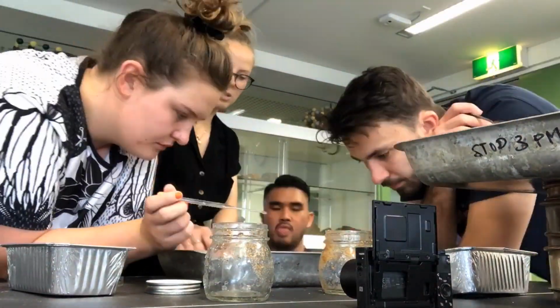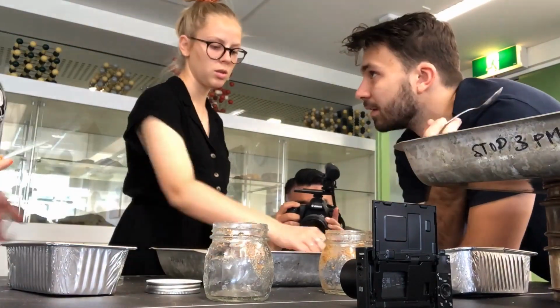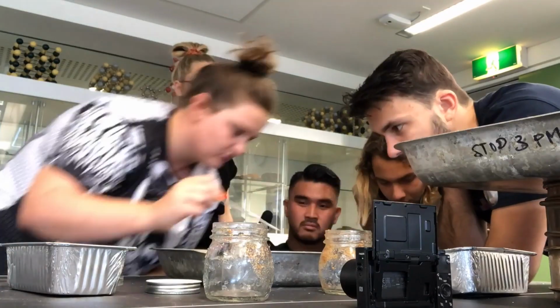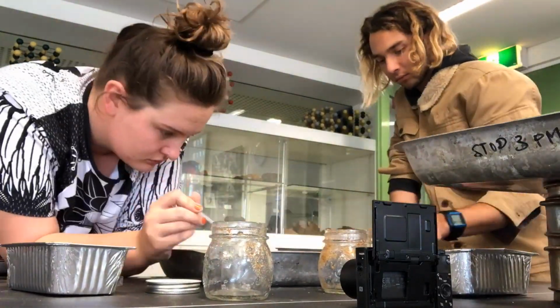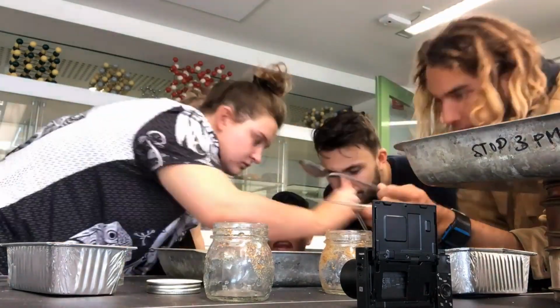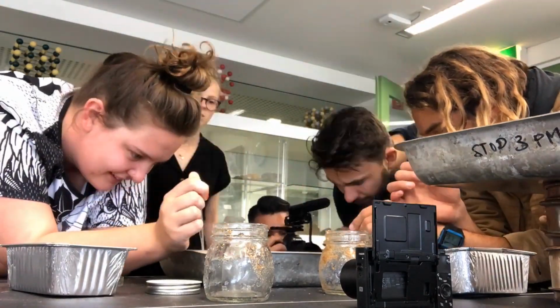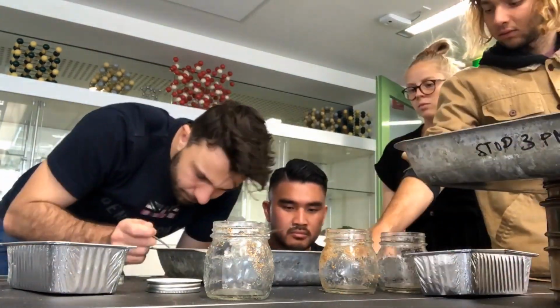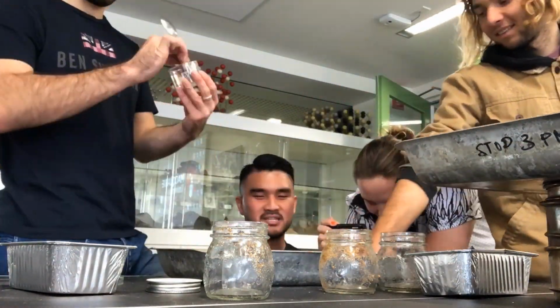Lab sampling was definitely a bit of a process. First, we had to make a salt solution with salt and water. Then we had to put all of our sediment inside that solution and continually keep stirring it up. All the while, we had to make sure we were all wearing 100% cotton clothes and that none of our materials were plastic.